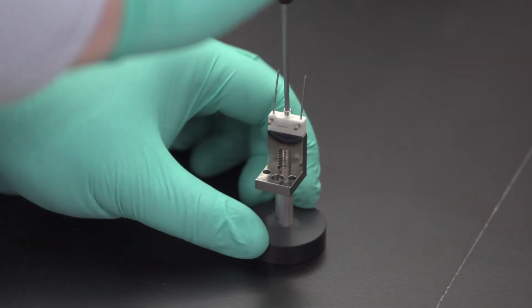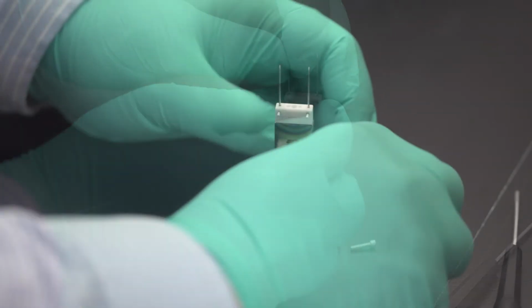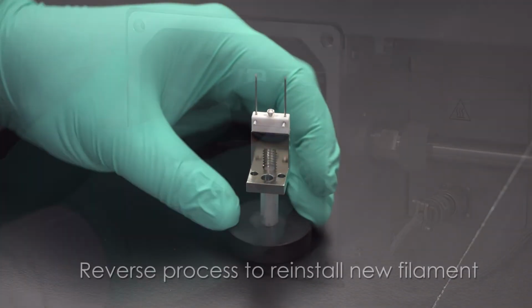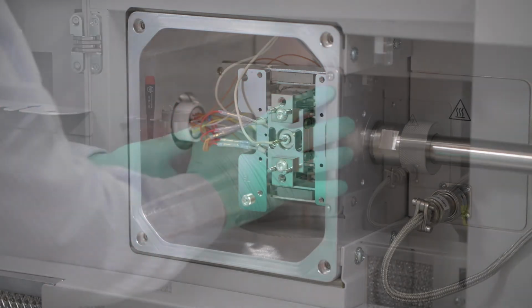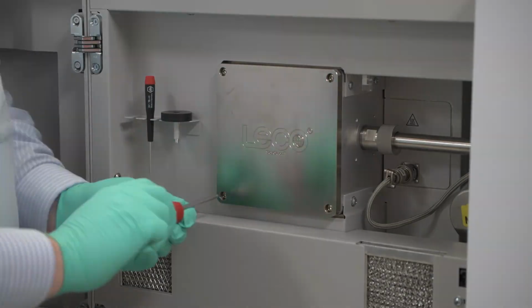Flip the tool on end to use as a stand, then remove the screw holding the filament to replace the old filament with a new one. Reverse these steps to get up and running again. Once you have done this process once, it will become second nature.